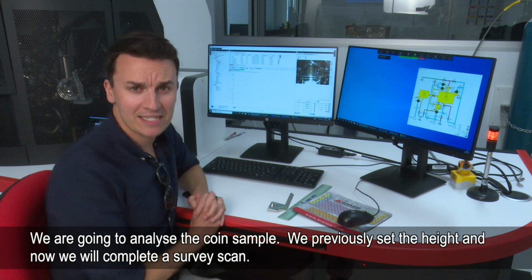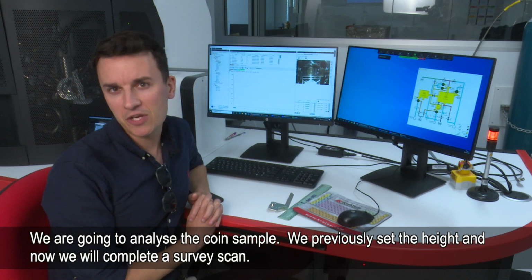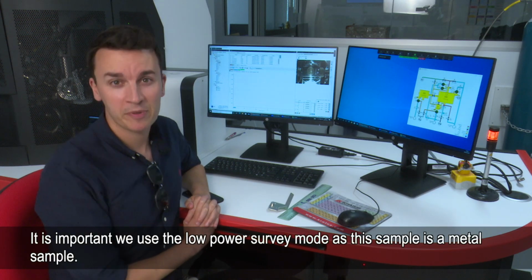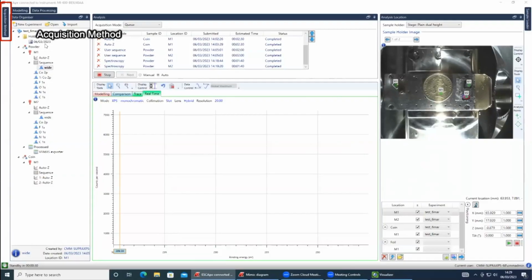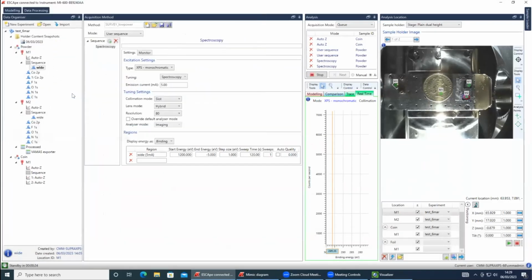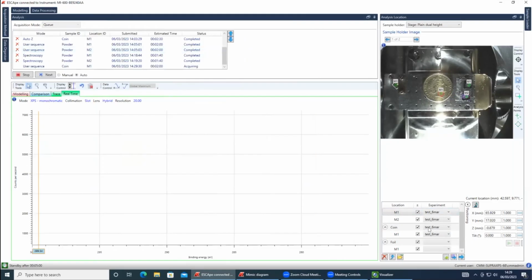So we're now going to analyse the coin sample. So previously we set the height, and now we're going to do a survey scan on this. I said before there's the high power and the low power. It's very important that we use the low power first because it's a metal. We're not sure whether high power will be too strong. Acquisition methods, open survey low power, and I'm just going to submit this for acquisition, and now we'll see what we get.